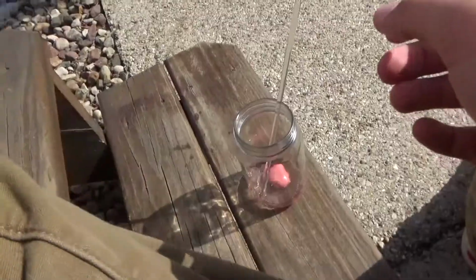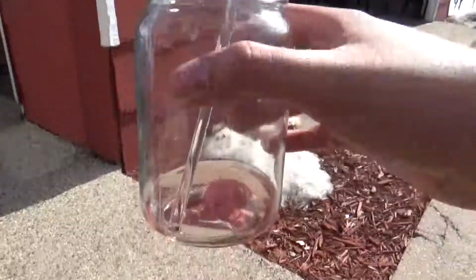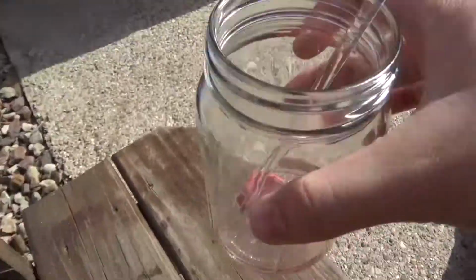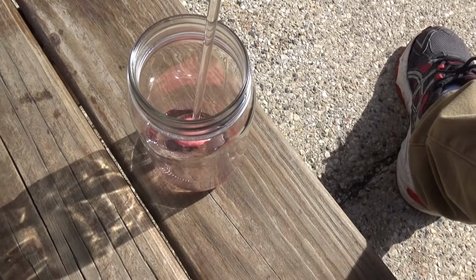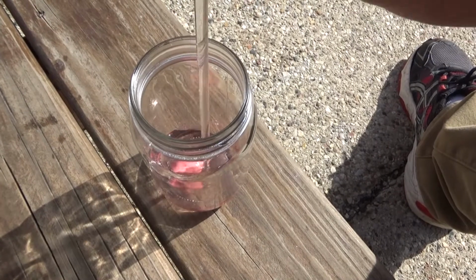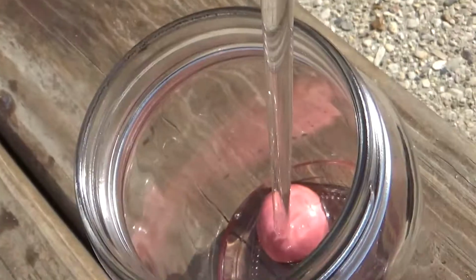Okay, it's been roughly 20 to 30 minutes since I first put a piece of Proto Putty into the solution of acid, and I have noticed something. I don't know if you can tell on camera, but the solution in there has taken on a bit of a pink color. I don't know exactly what's happening, but it's either just dissolving the food coloring out, or it's dissolving the entire putty itself. Not completely sure what it is yet, but if I put my glass rod into the putty, I can actually scrape away the outside layer of it. And so it's probably dissolving the putty itself.